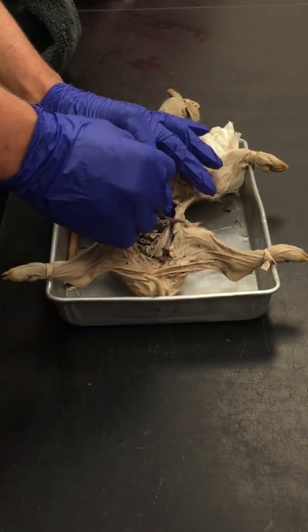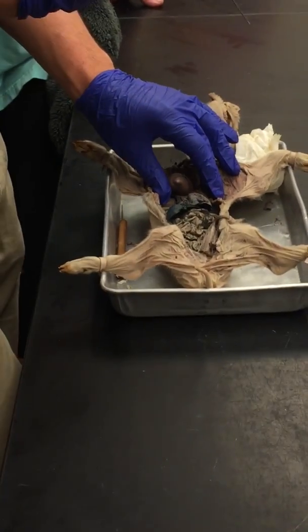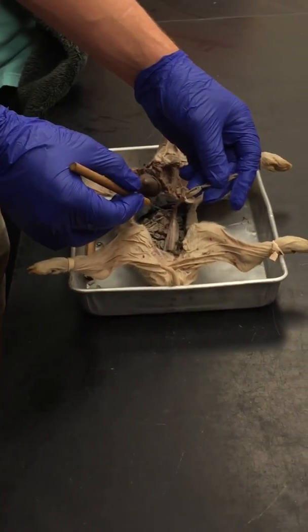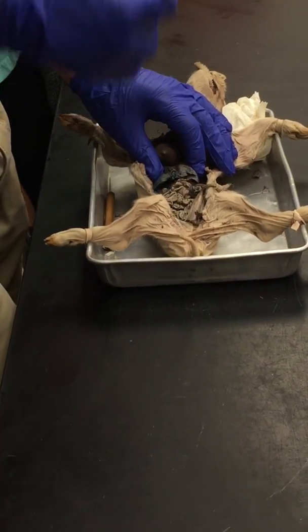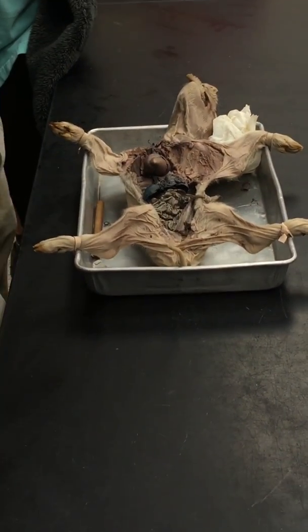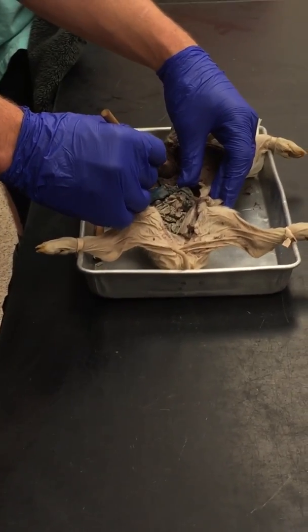So it's going to go through, this is the liver right here, and usually the liver will filter out and get rid of all the waste in the blood, but it doesn't need to do that because the mom's liver already did that because it's already basically filtered and oxygenated. So it's going to go through what is called the ductus venosus. It is another type of hepatic shunt basically, so it's going to go literally just straight through the liver without touching it. So that's what it's going to go through, and you really can't see it.